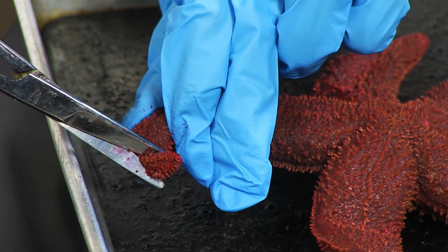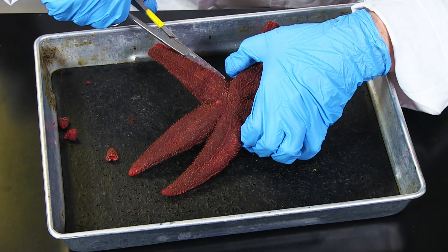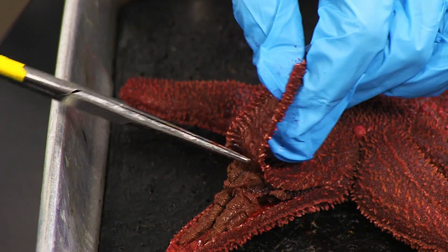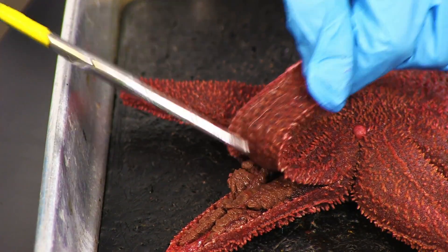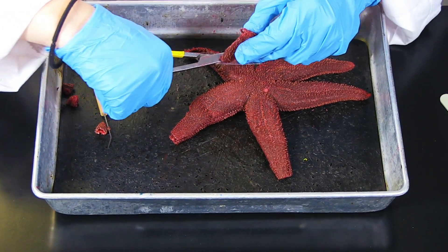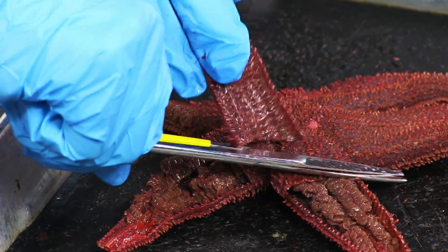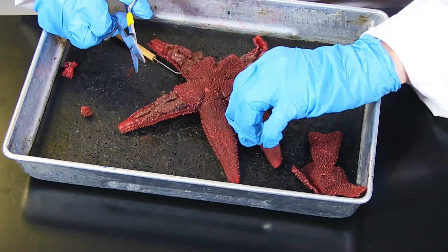Proceeding one arm at a time, the tips of the arms are cut off and the sides of the arm are cut toward the central disc. The cuts are made as close to the skin as possible. Notice that the skin is lifted as it is cut and the point of the scissors is used. This allows for the removal of the flap, or aboral surface tissue. The flap is cut away to reveal the internal organs. This is repeated for the other two arms.